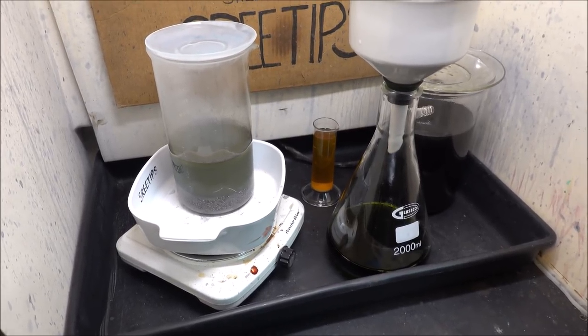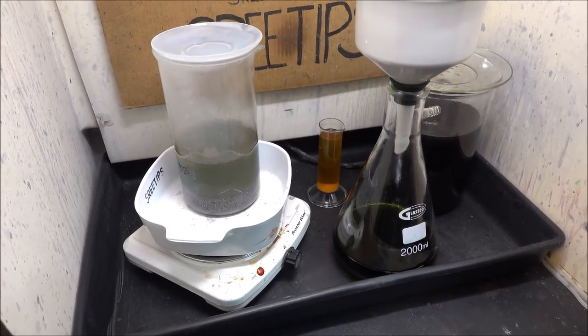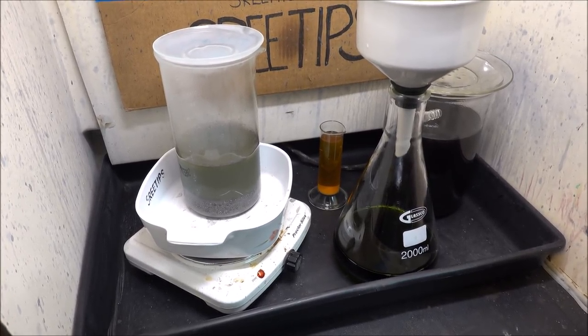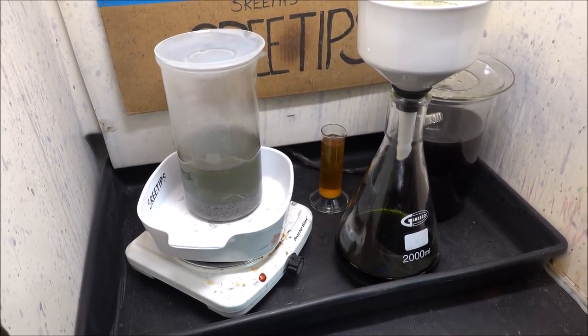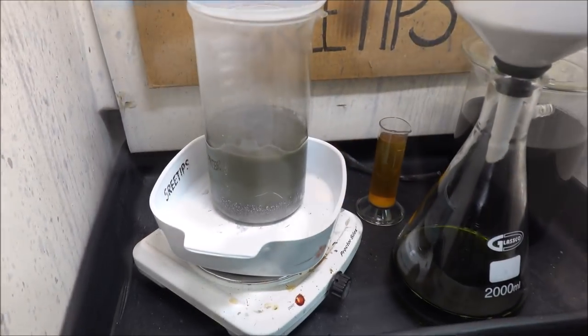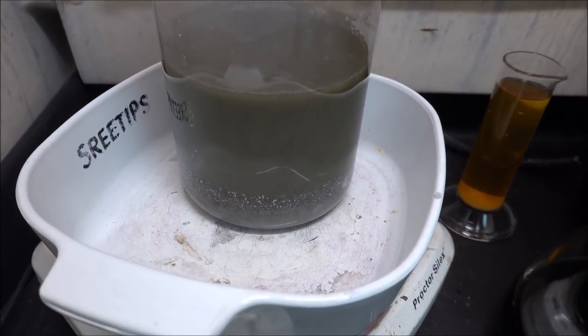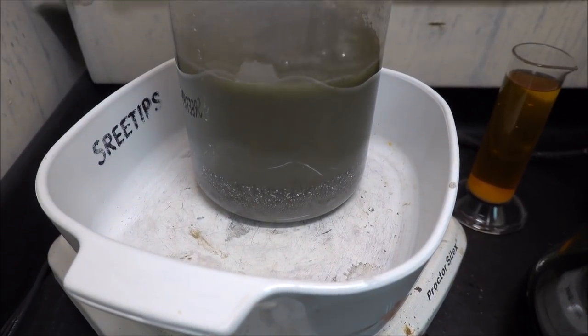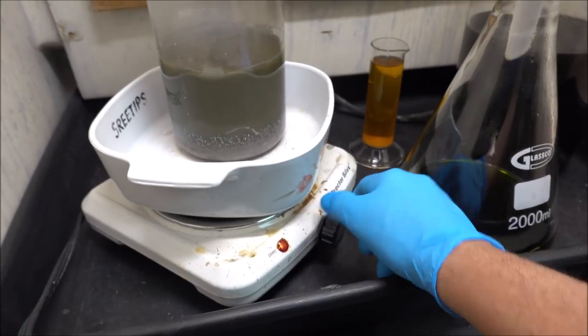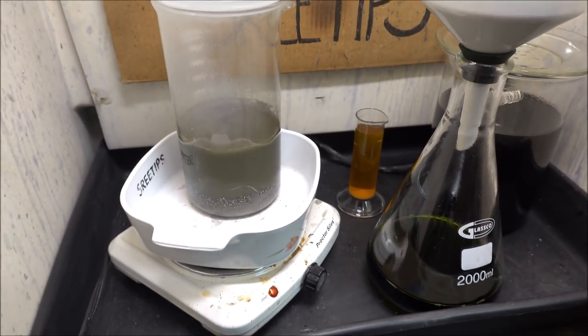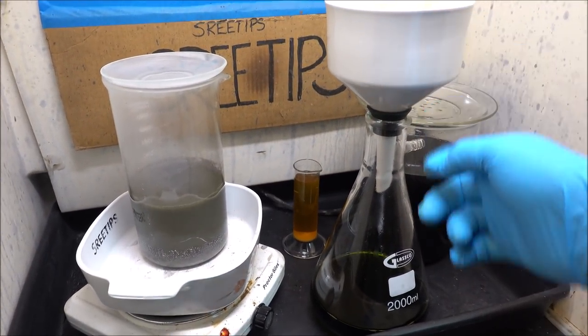I'm giving this my very best effort, even though I know that I'm going to get less than a tenth of a gram, if anything, out of this experiment. And I'm making this up as I go. I've had my material boiling in the hydrochloric acid now for about an hour and a half. What we're going to do is turn this off now, let it cool down, and then I'll get that solution off of the material through this funnel here.